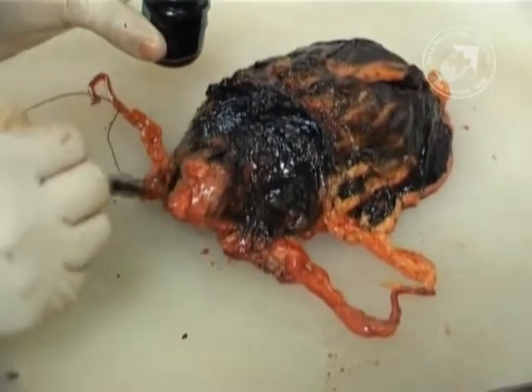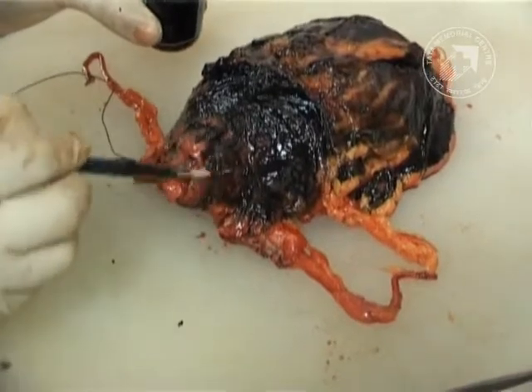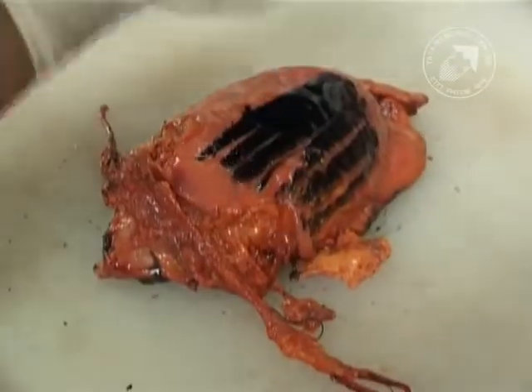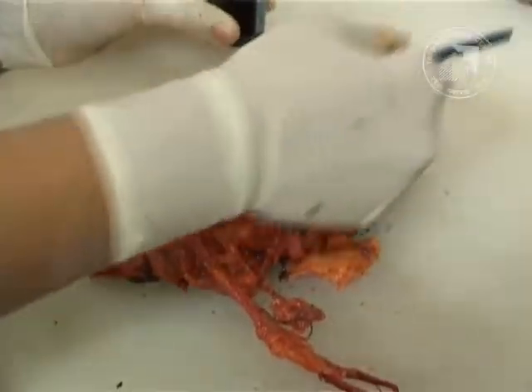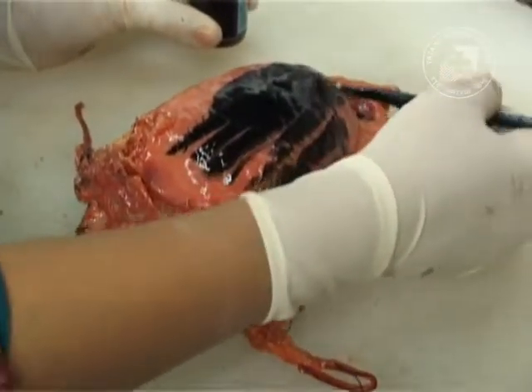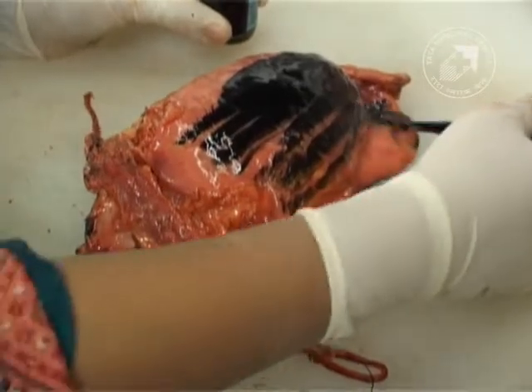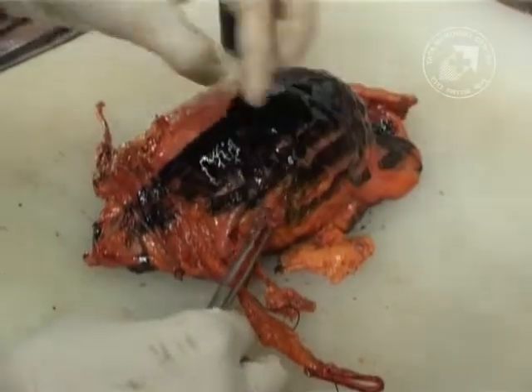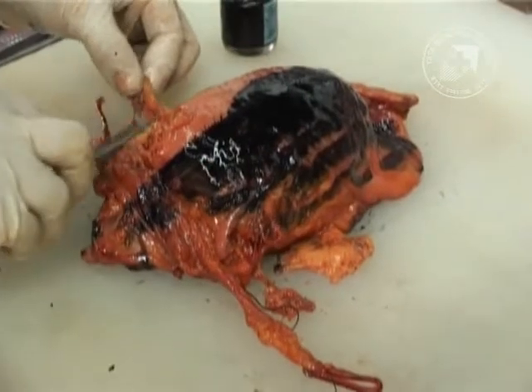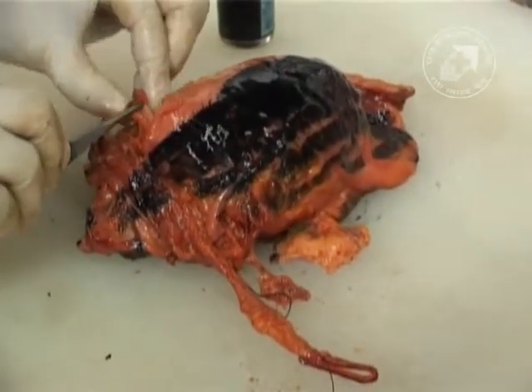This is the complete painting of the posterior aspect. Now we go on to the anterior aspect — the peritonealized margin. Some people may not prefer to ink the peritonealized margin as the peritoneum can be seen on microscopy. These are both the ureters which are being shown here with the forceps.